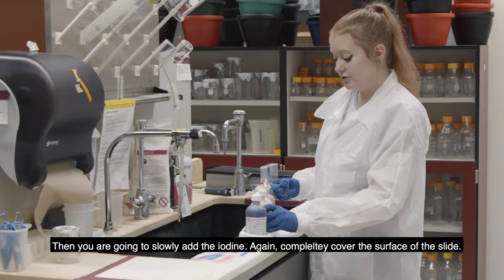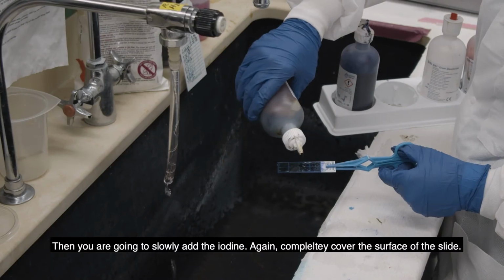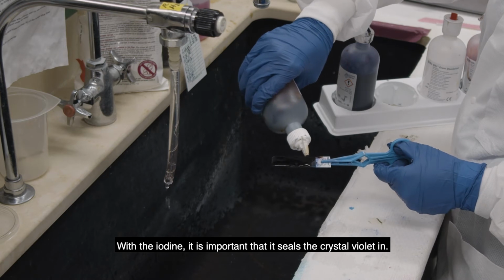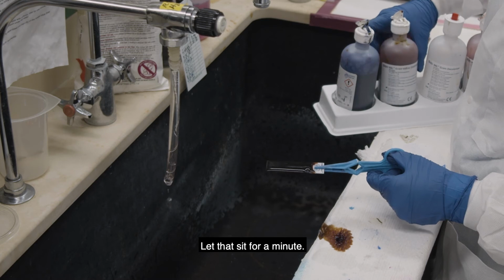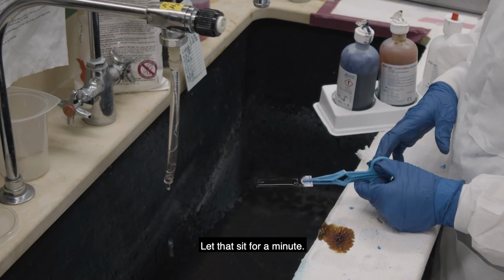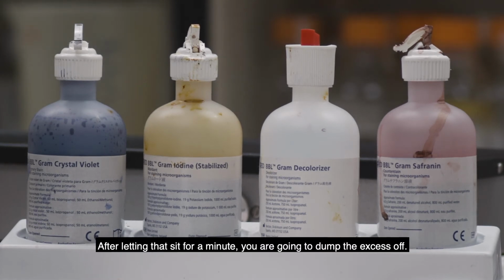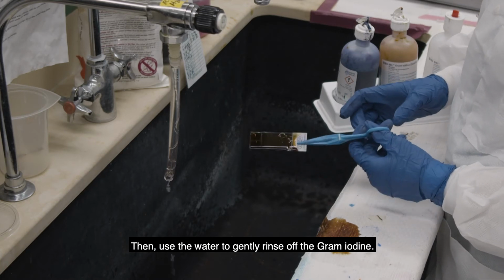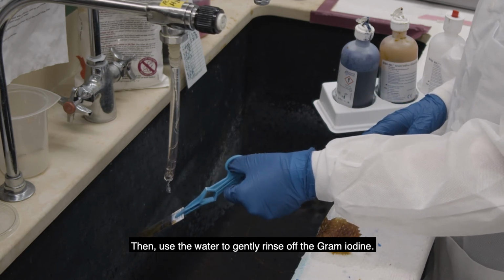Then you're going to slowly add the iodine, and again completely cover the surface of the slide. And the iodine is just a mordant that seals the crystal violet in. So then you're going to let that sit for a minute, and all of these stains that you're using are in order in the bottles. So then after letting that sit for a minute, you're going to dump the excess off and use the water to gently dropwise rinse off the gram iodine.